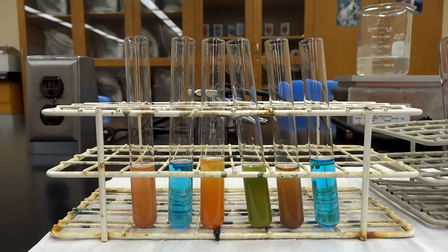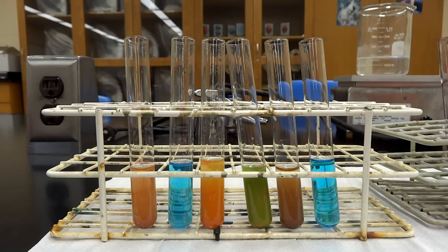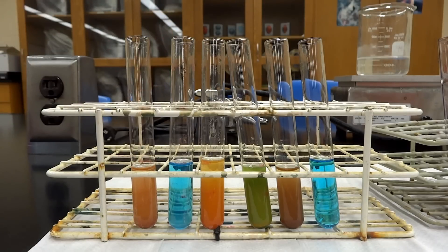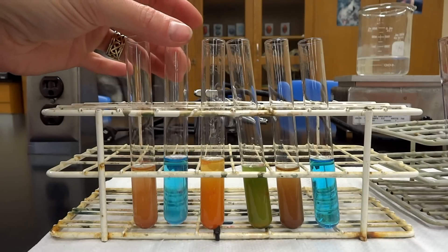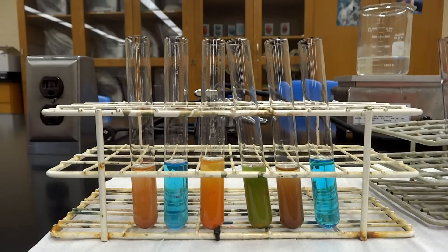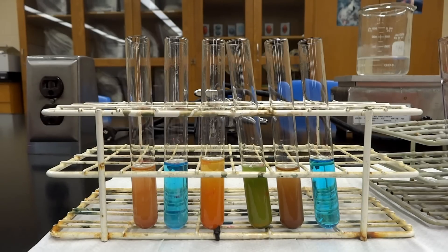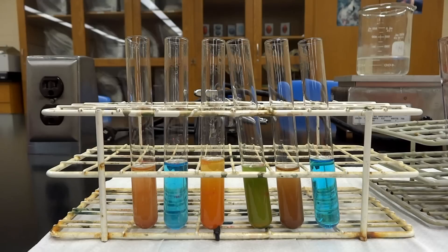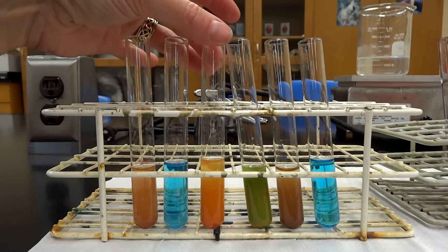This is going to give you a comparison to look at all the other tubes, because remember this is going to be a qualitative, not quantitative, lab. Test tube number two is the negative control. In the case of this lab we are going to use water, because water has nothing in it — no proteins, no sugars, nothing — so it is a perfect negative control. In future labs we may not always use water, but for today we are.